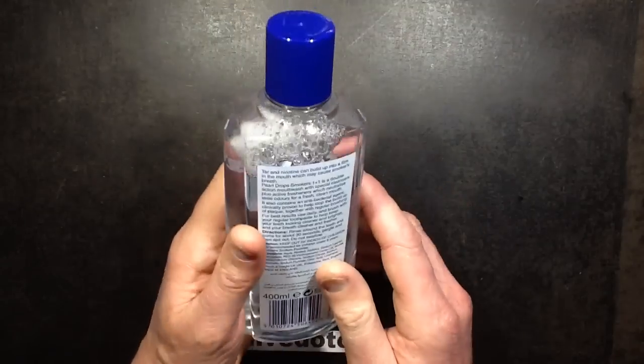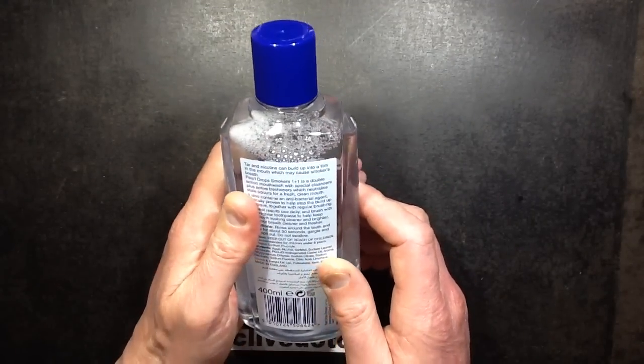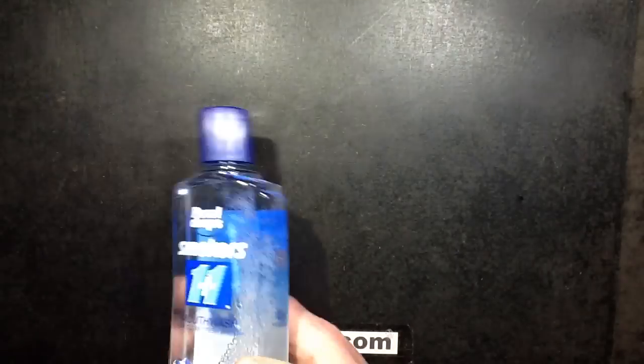So I was expecting to distill this and find it was going to probably carry a lot of the flavour across in it. So here's what actually happened.